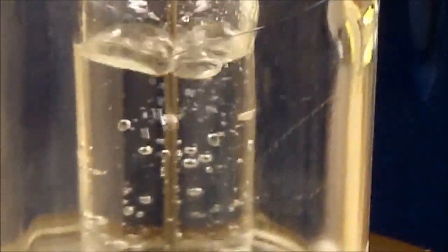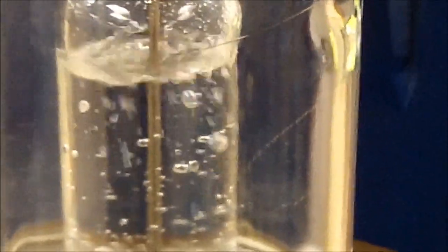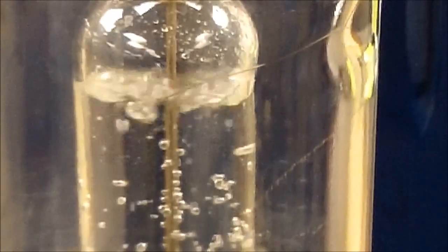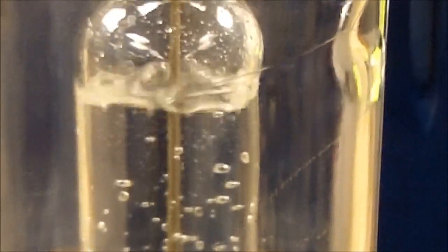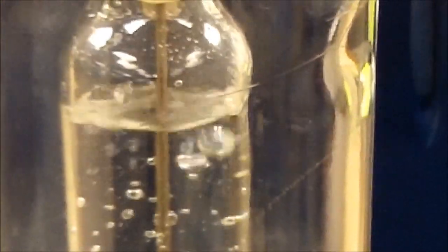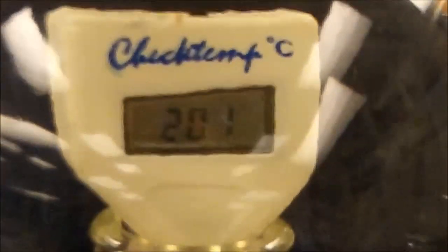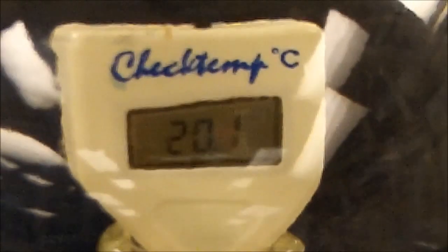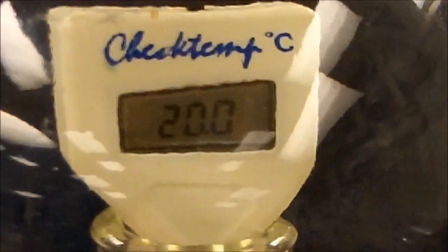Let's see if we can get it down to 20. I bet we can get this down to 19. Again, as this is still boiling. And again, when we talk about boiling, boiling is relative. It doesn't necessarily mean that something is hot. What it simply means is that the vapor pressure above the liquid is the same as the atmospheric pressure. And so the intermolecular forces are able to weaken and cause this liquid to turn into a gas. Now the temperature is at 20.1. I'll bet you we'll be able to get into the 19s before this is all finished.